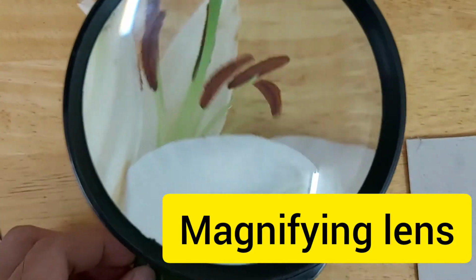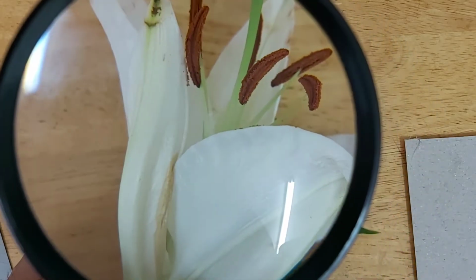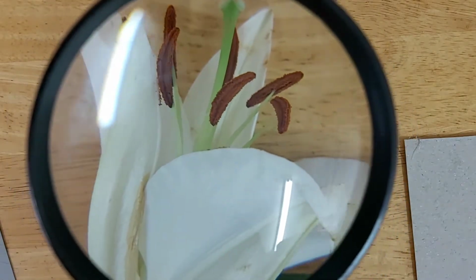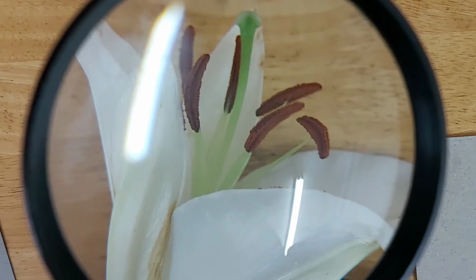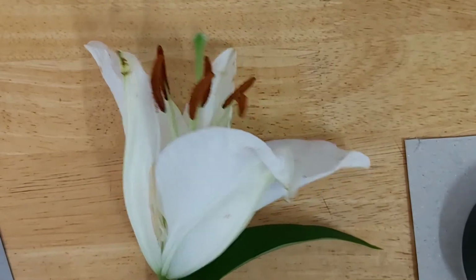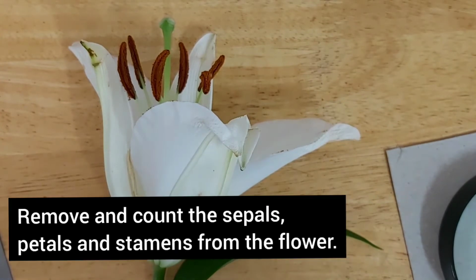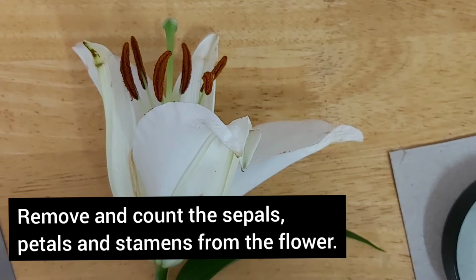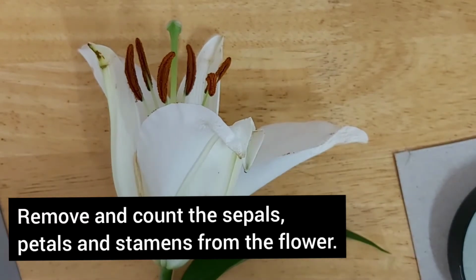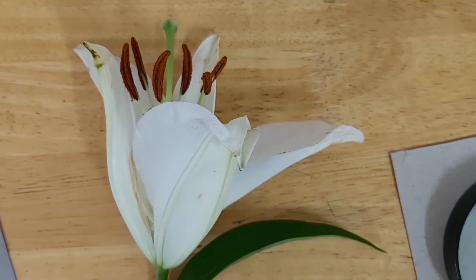So as you can see here, those are the different parts of the flower that we studied in the class, right? And the flower smells so good. The scent is so sweet. So you know that they have this kind of scent to attract insects, right? Anyway, so let's go to the procedure. In the procedure, you are being asked to remove and count the sepals, the petals, and the stamens from the flower. So unfortunately, we are going to separate the parts of this flower for the sake of experiment.